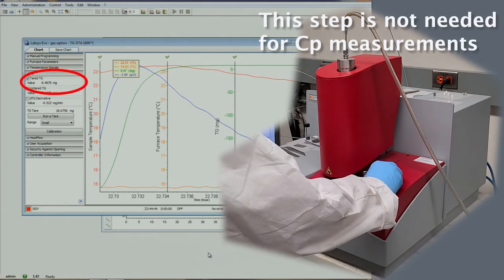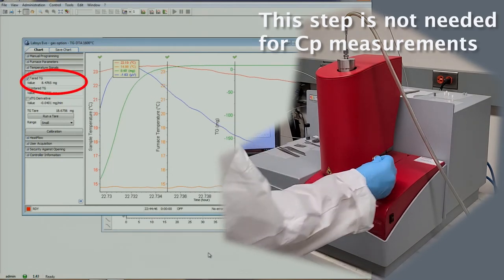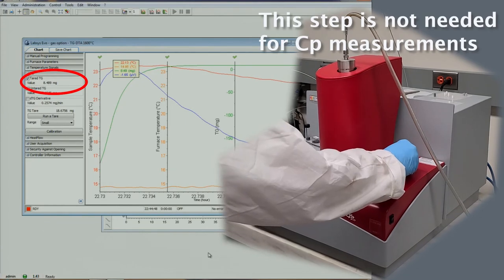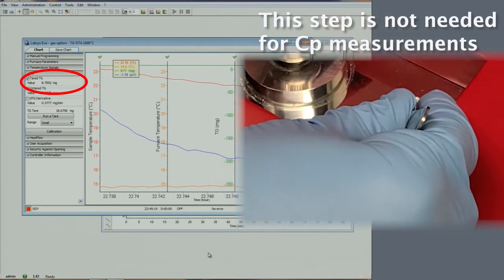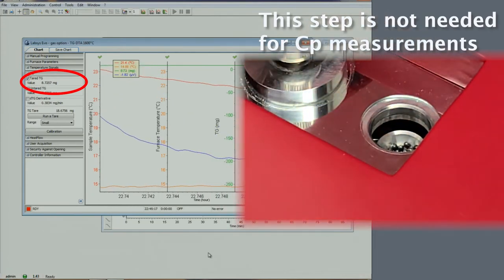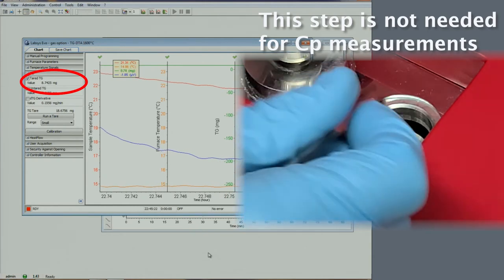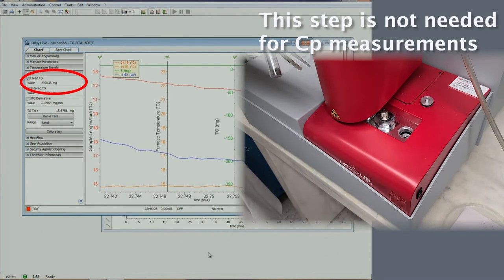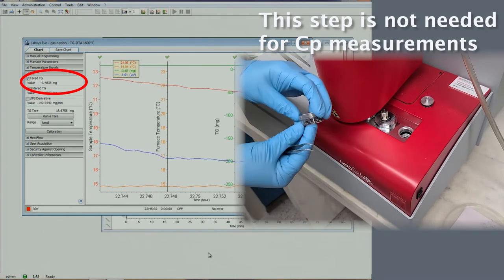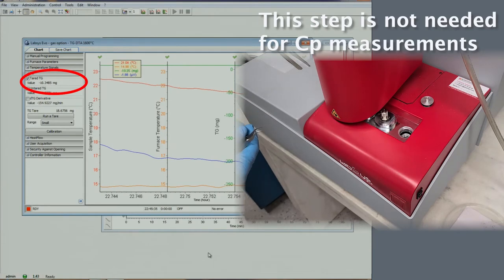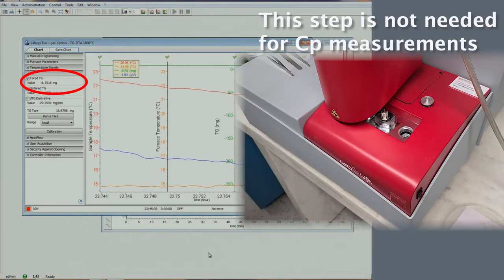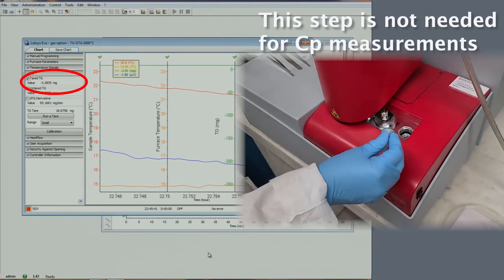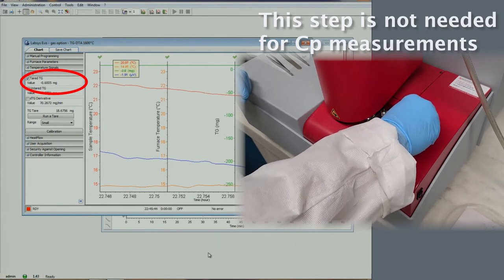We now need to zero out the instrument balance. Pull the cover and add or remove weights in the tare pan. The taring process is slow as the balance needs time to recover. There are two sets of weights to set the balance to zero.